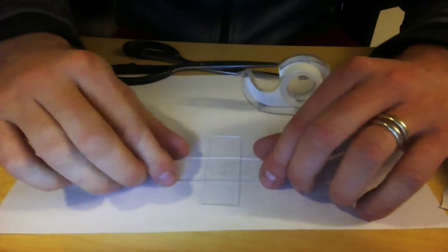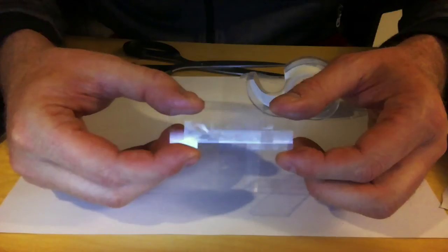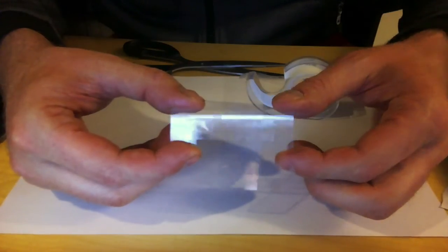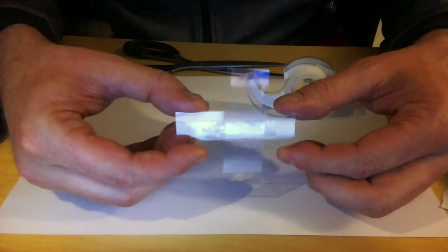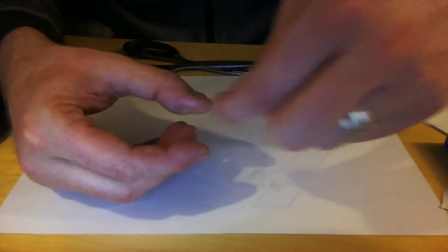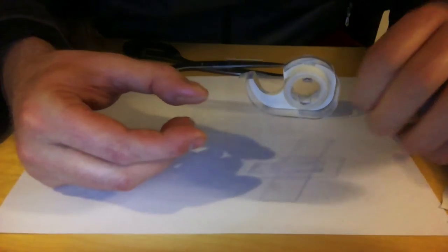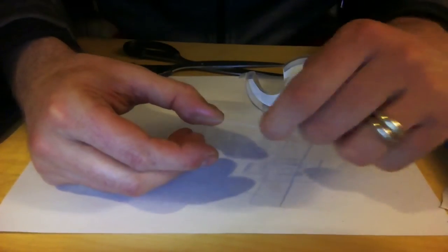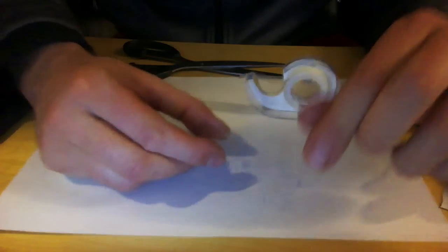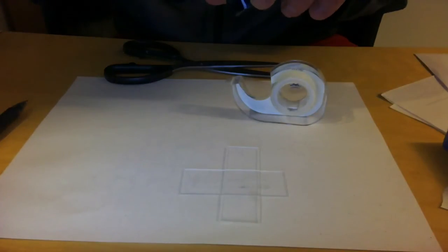So now I have two pieces of glass taped together by a piece of tape. And you can hardly see that. I try to reflect, so you see the reflection, because you can't really see the tape very well. And there's a little groove that I cut with my scissors in here. The tape is typically 50 micron thick. So I now have a channel that is maybe less than a millimeter wide, but only 50 micrometer high between two glass walls. And let's see if this actually works as a microfluidic channel.